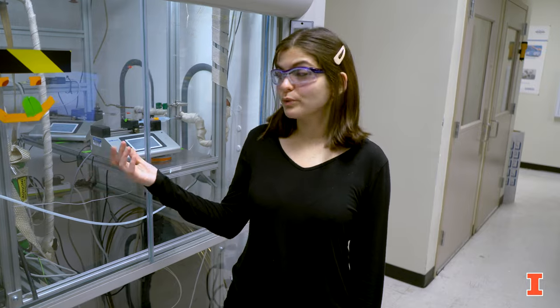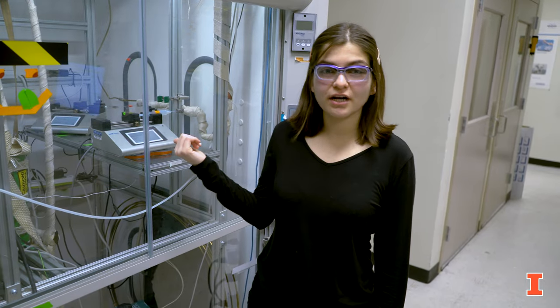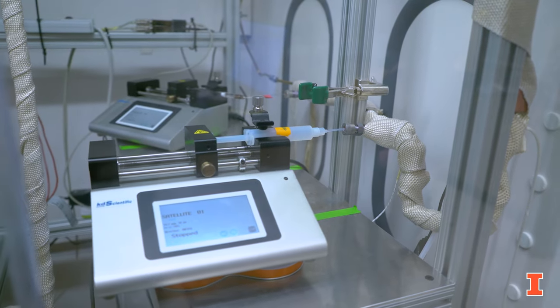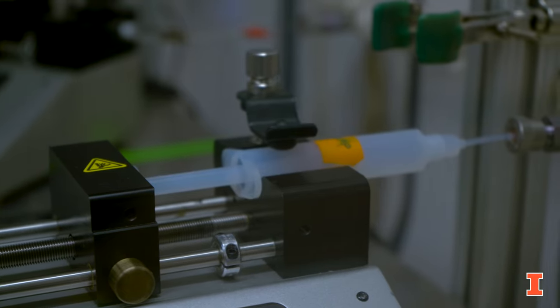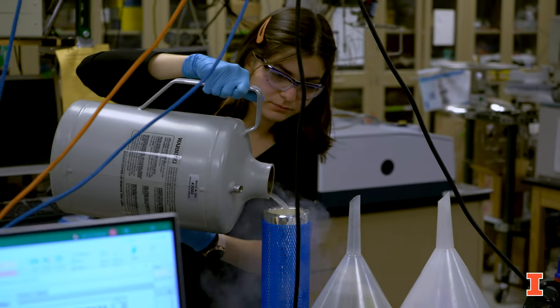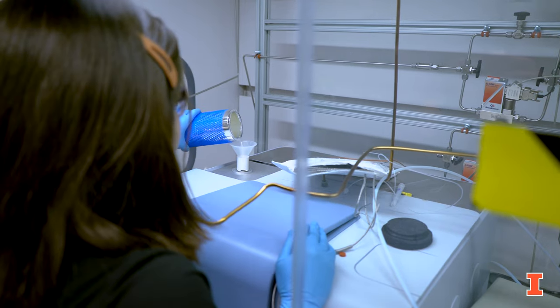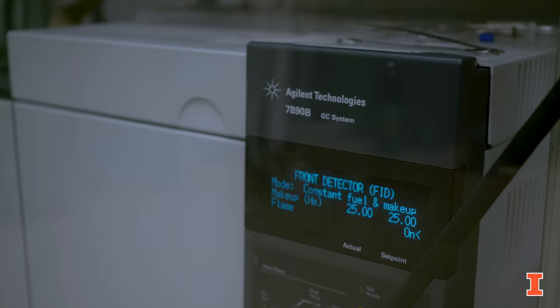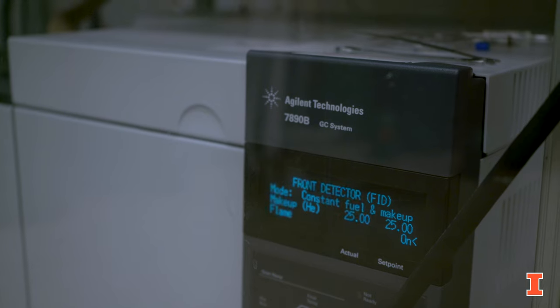Here we have a gas phase epoxidation system, for which reactants are fed through these syringe pumps, and the products are analyzed with a gas chromatograph. This system also has an inline infrared spectrometer for operando measurements, so you can measure kinetics and see what's going on on the catalyst surface simultaneously.